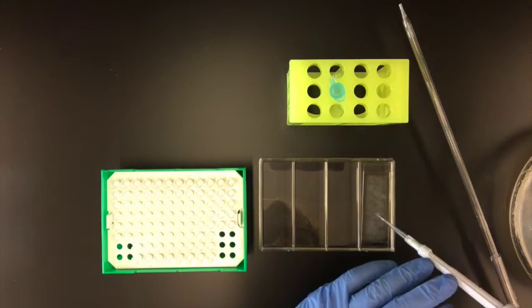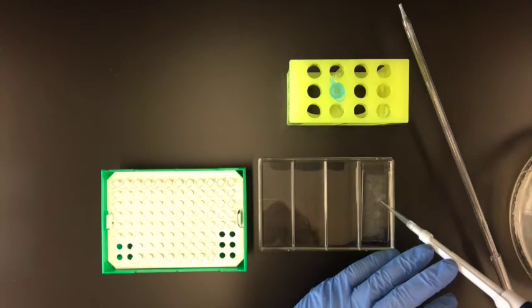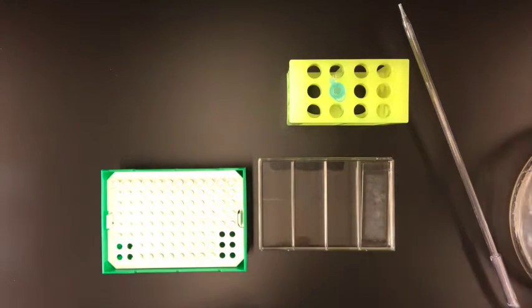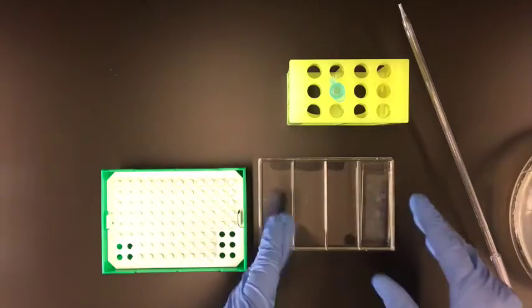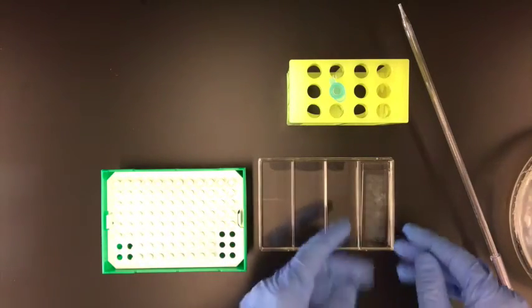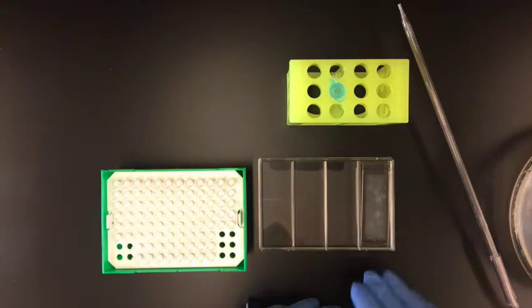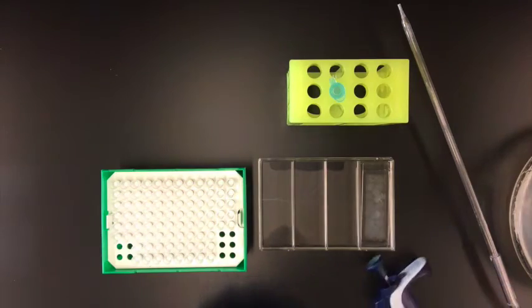And as I'm looking, I can see areas that have better coverage than others. So I can move the beads around, but here you can see that the beads are generally covering the entire surface of the device.